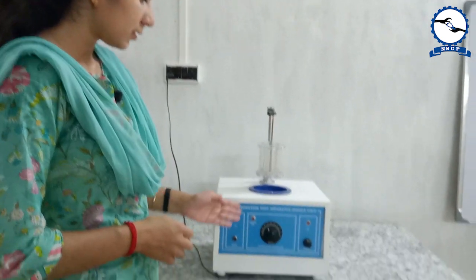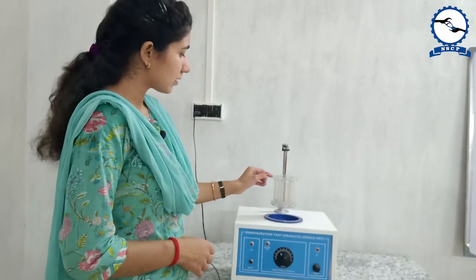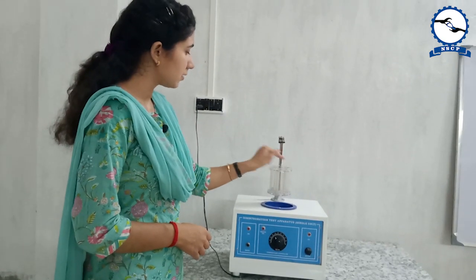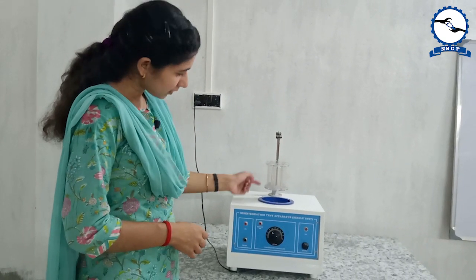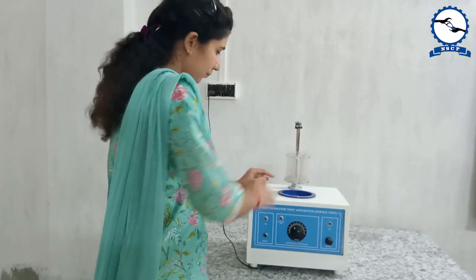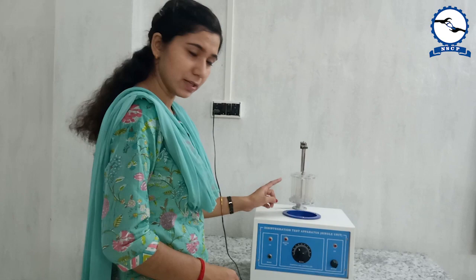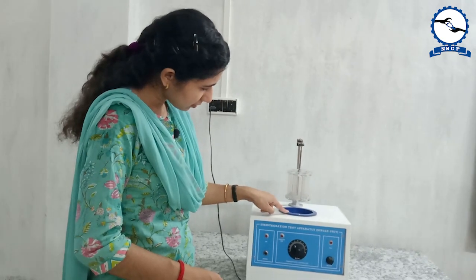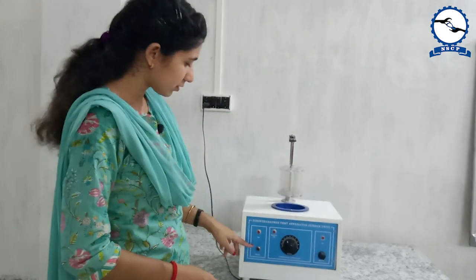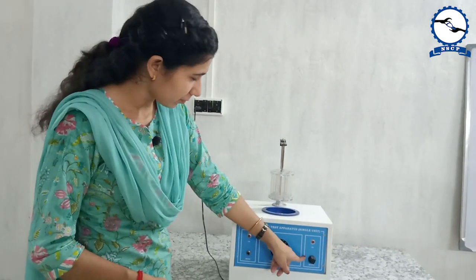This is a disintegration test apparatus which is a single unit. As you can see there are 6 holes here, and in each hole one tablet will be placed. On the top of each tablet one disk will be placed. There will be a 1000 ml beaker where 900 ml of liquid or water will be placed. Here is a hot plate where the temperature can be maintained and controlled. When switched on, this will start going up and down — you can control the motor movement from here.